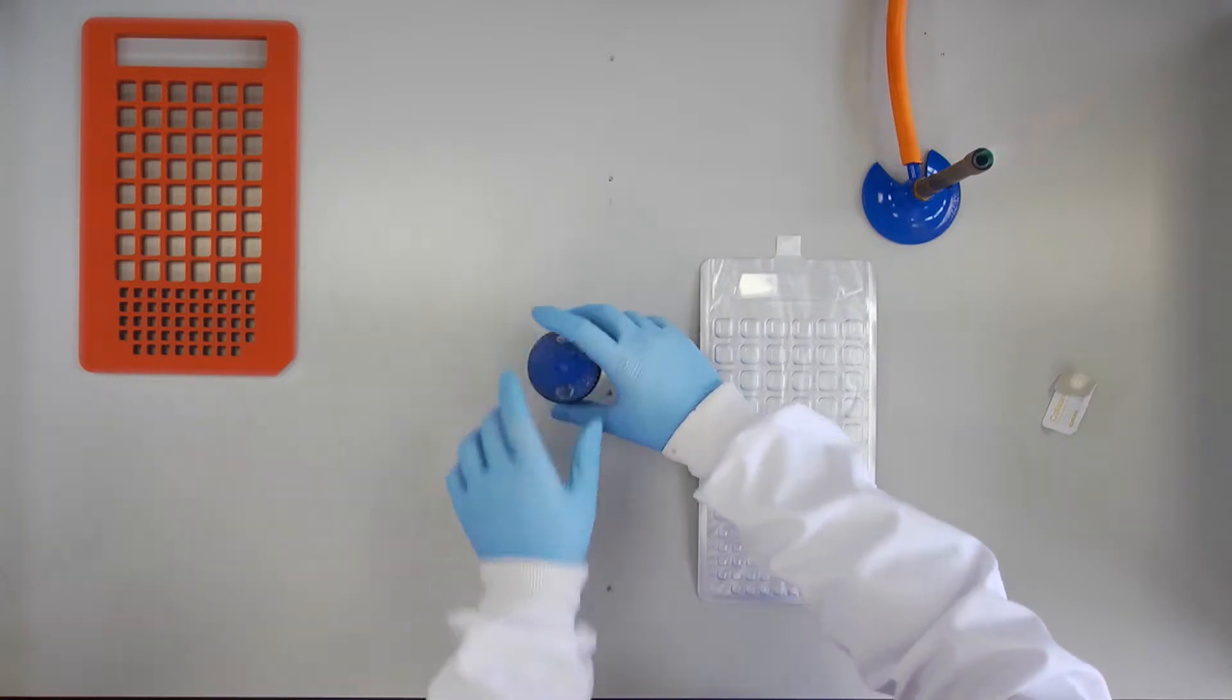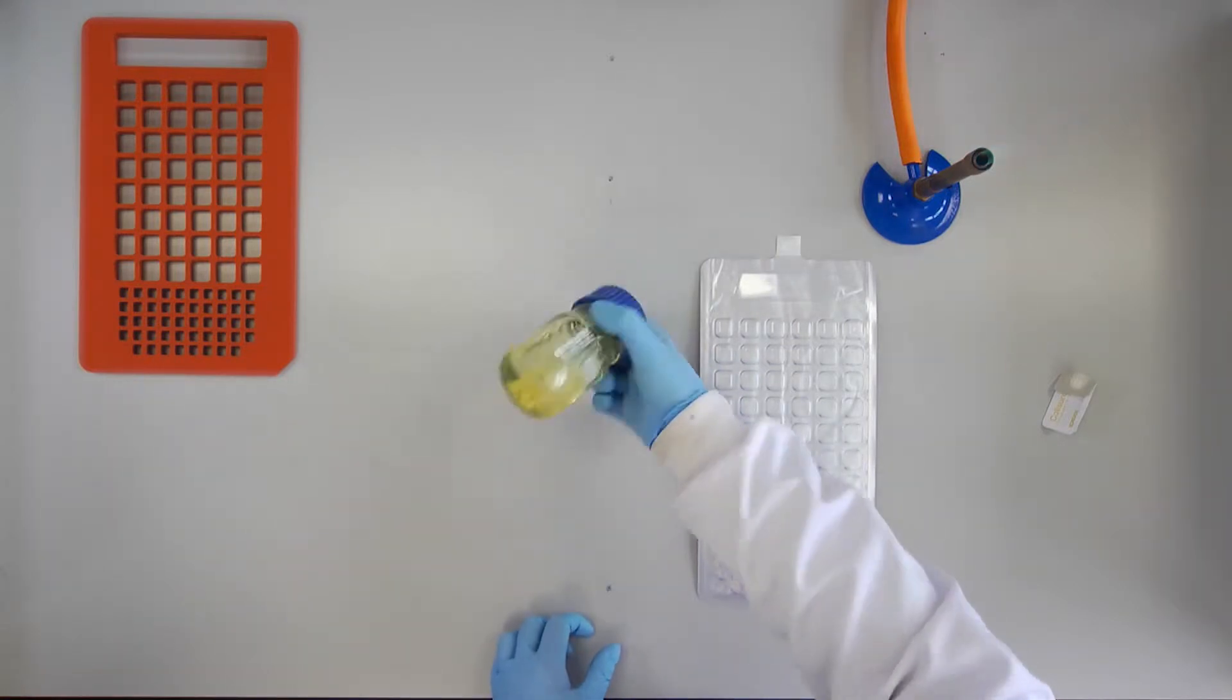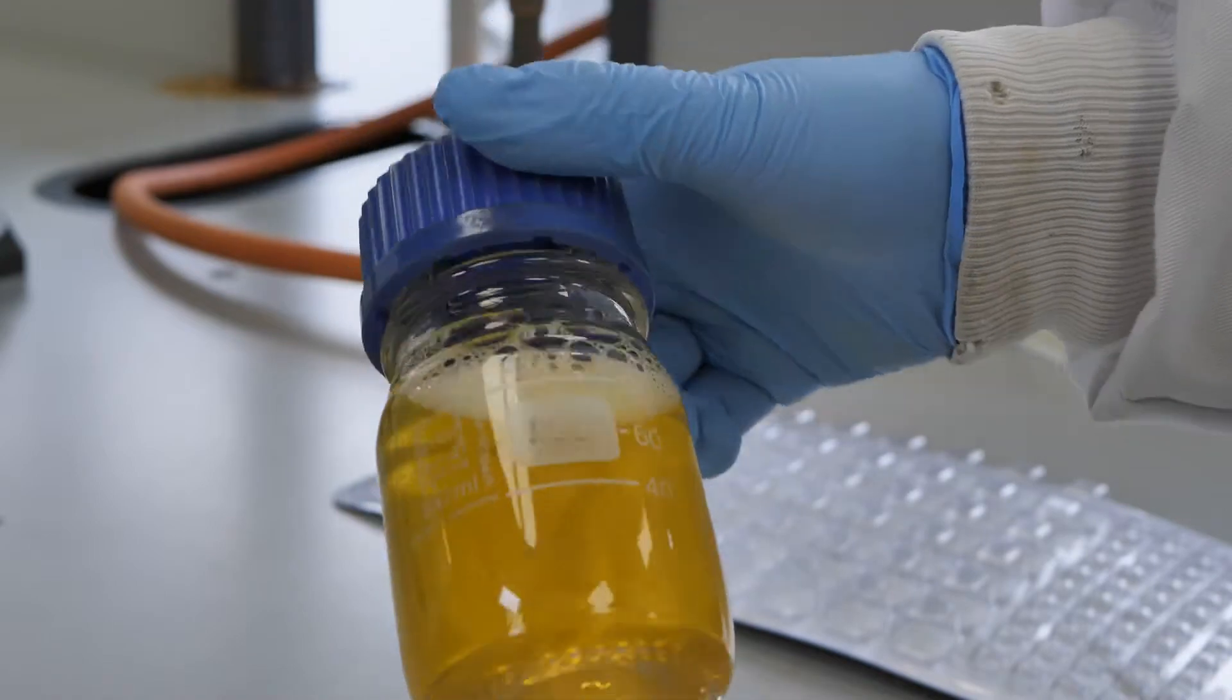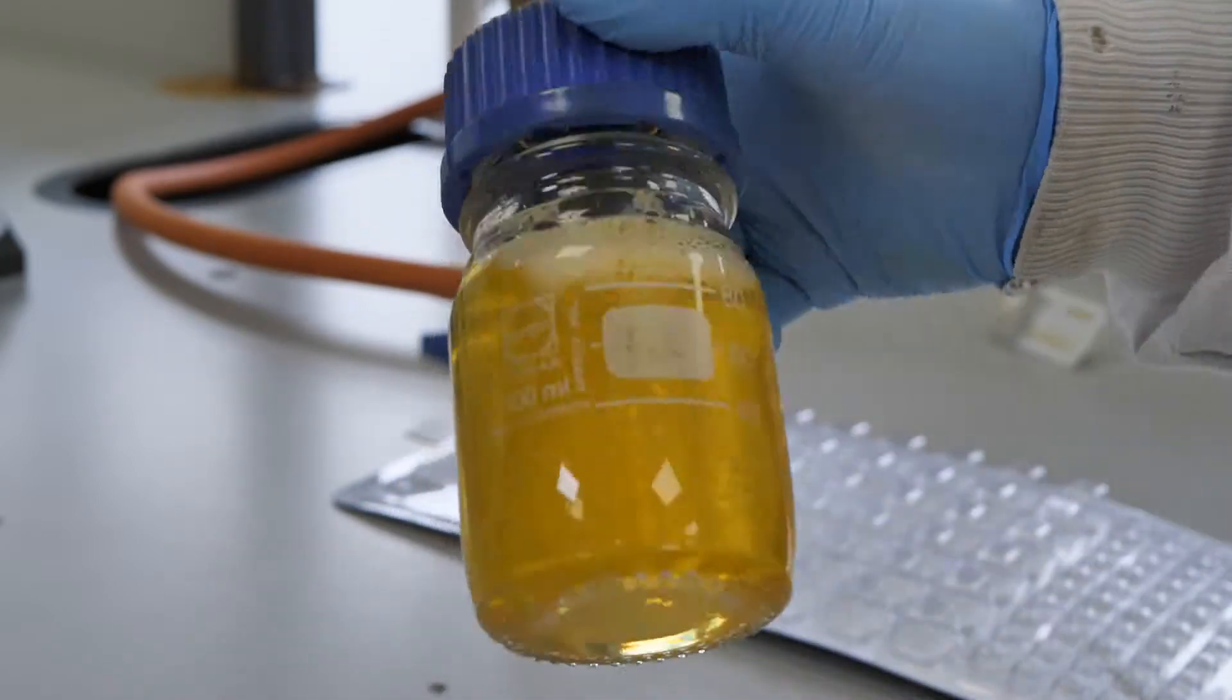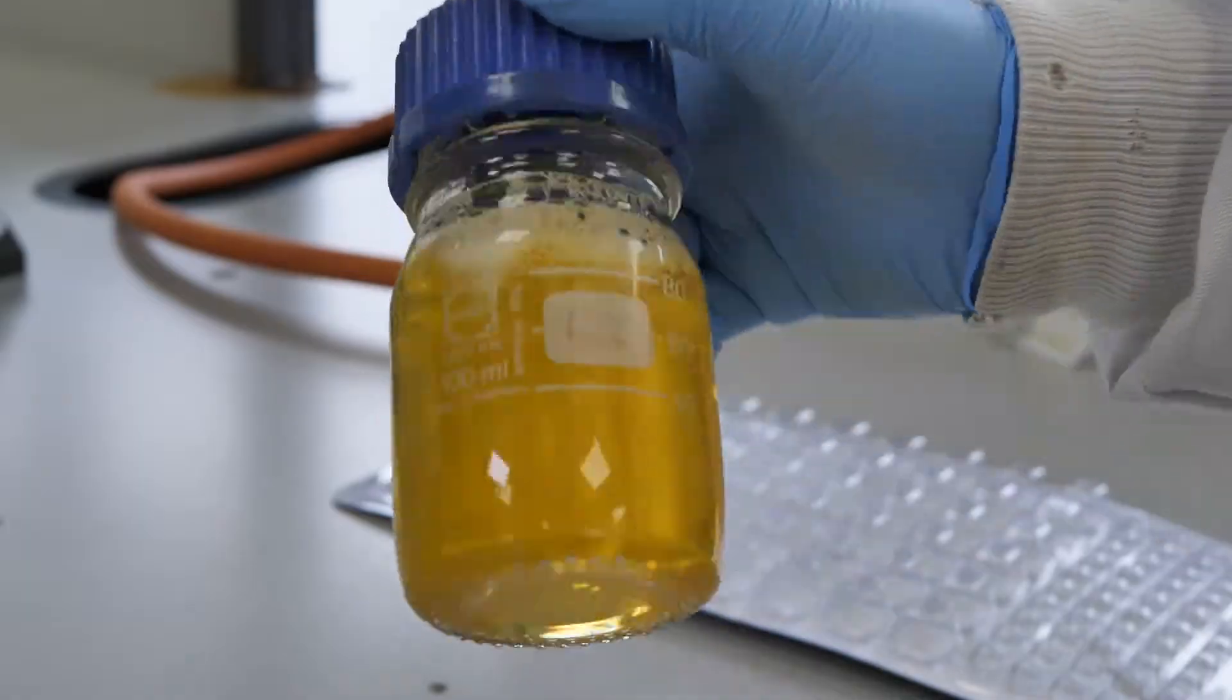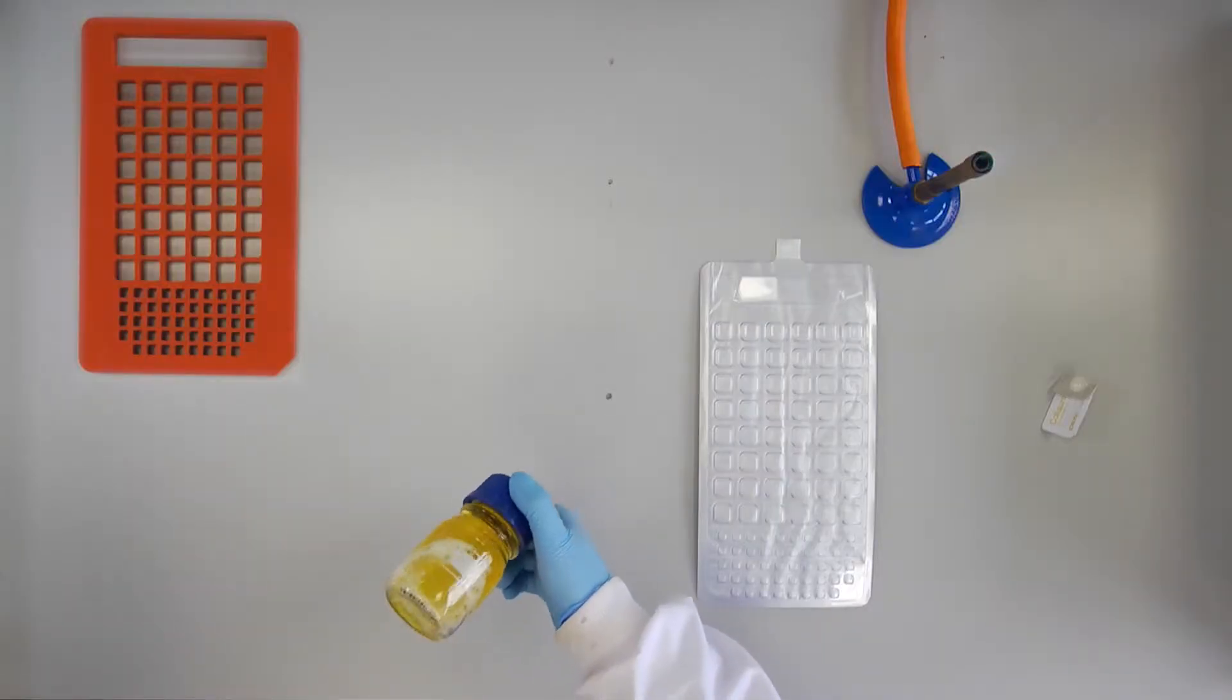Recap and invert the bottle repeatedly but gently in order to avoid introducing air bubbles until the reagent is fully dissolved.